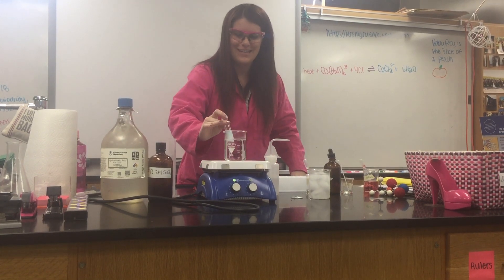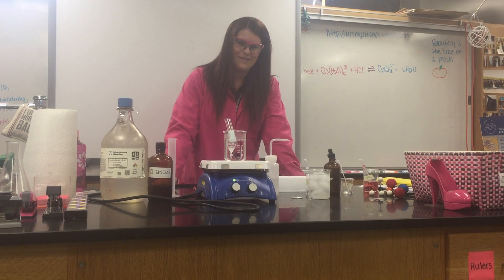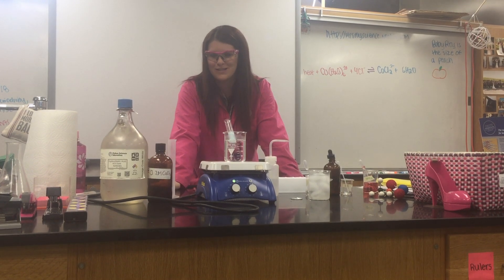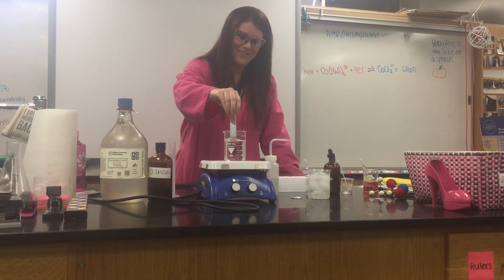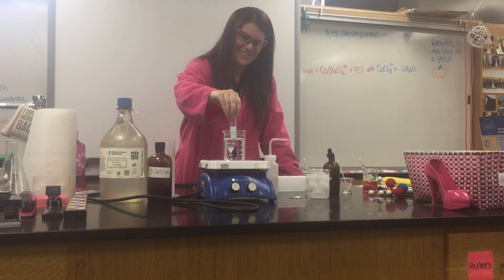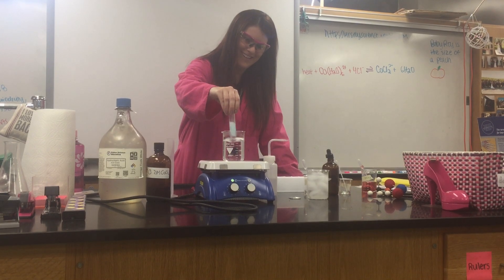And then we are going to heat it up, which is going to shift it back to blue. Kind of a rainbow in there.